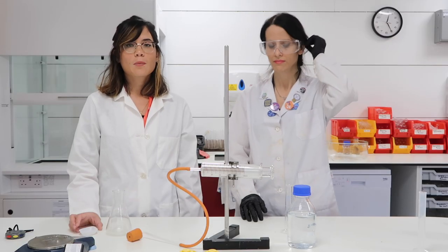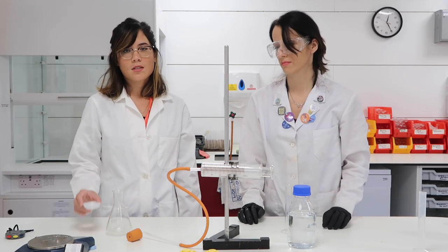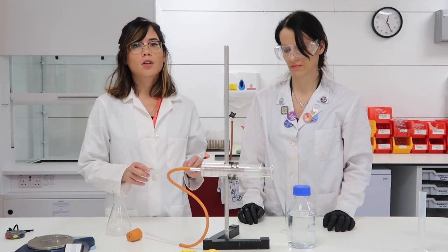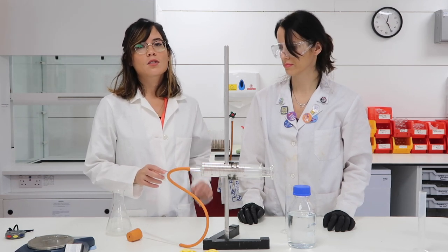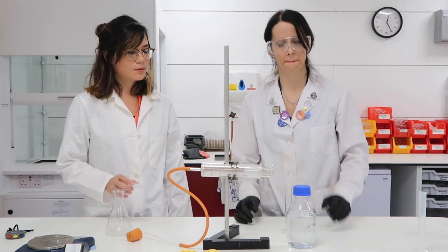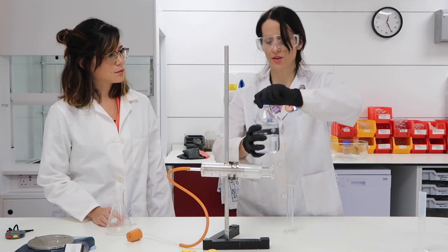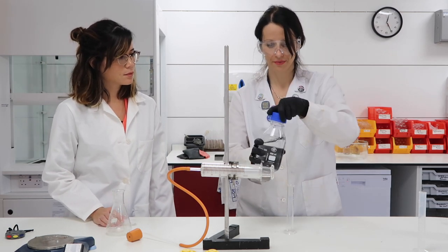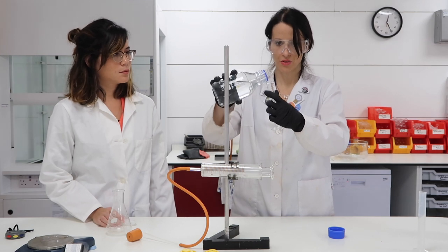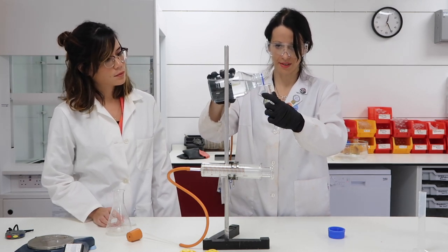We're now going to repeat the experiment, this time using calcium carbonate chips, and obviously maintaining the same volume and concentration of hydrochloric acid — again 0.5 molarity hydrochloric acid, 25 cubic centimeters.